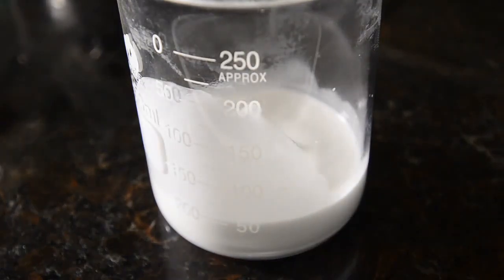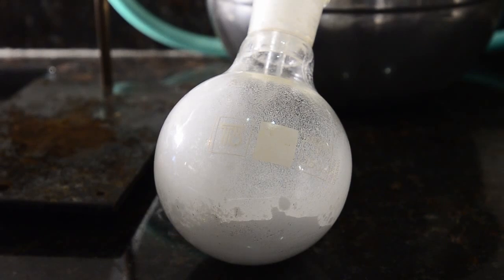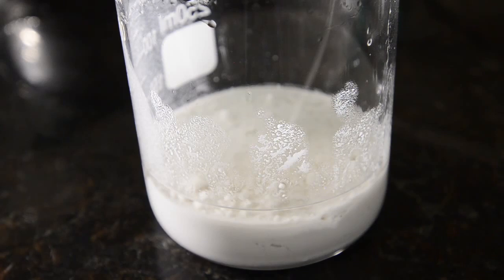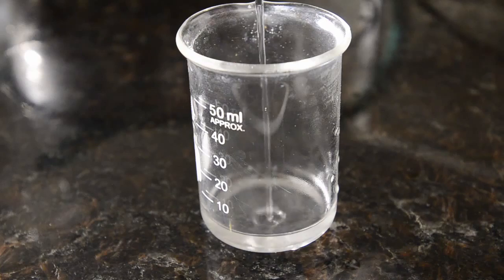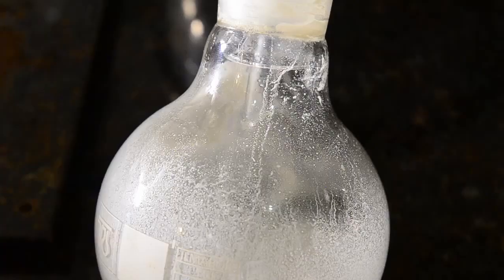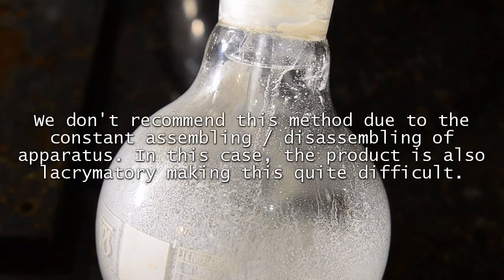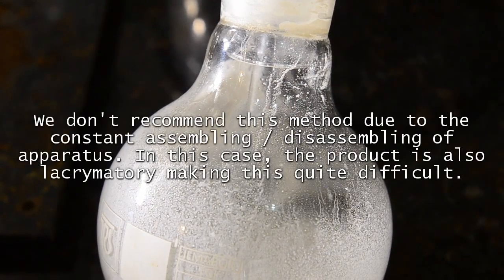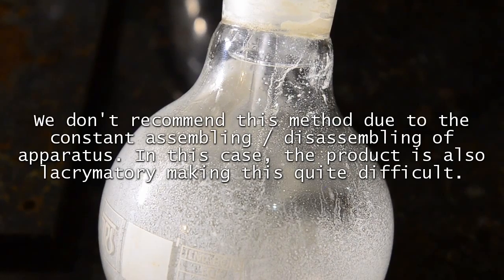Then we replaced the calcium oxide in the receiving flask and continued the process, and once the mixture had settled we placed the alcohol back into the boiling flask. To be honest, this was all a bit of a pain because it meant constant disassembly and reassembly of the apparatus. And the product in this case is quite lachrymatory, which didn't help.